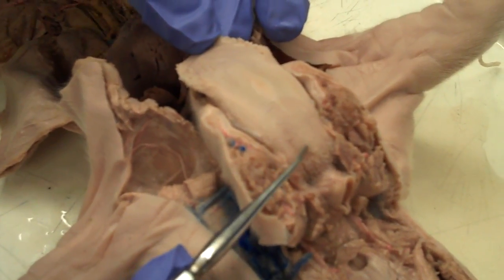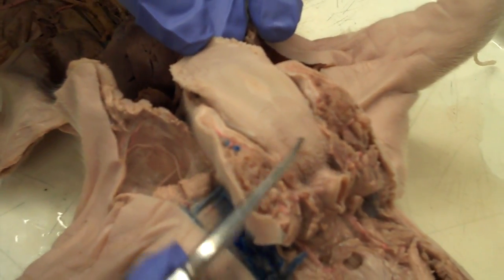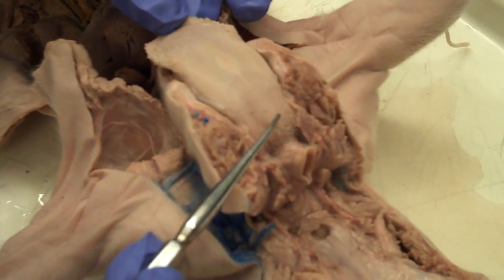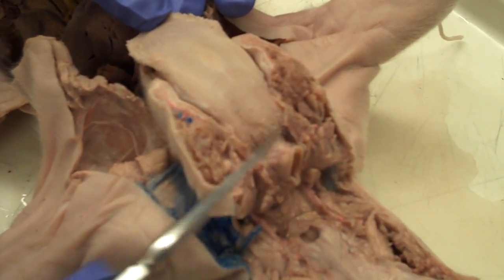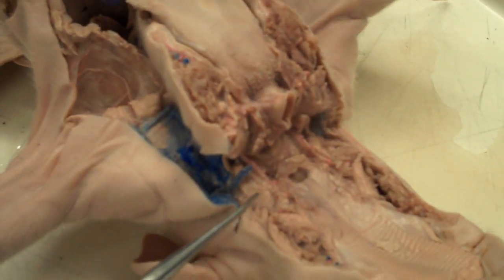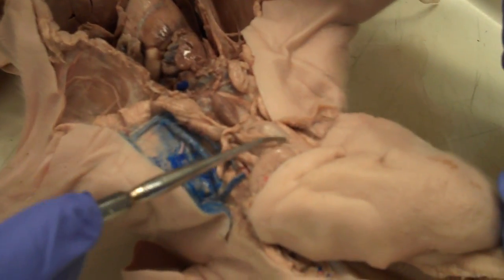Deeper are the filiform papillae. Then the hyoid bone was cut, so you would actually be pinned in four places. And then the last thing is the larynx.